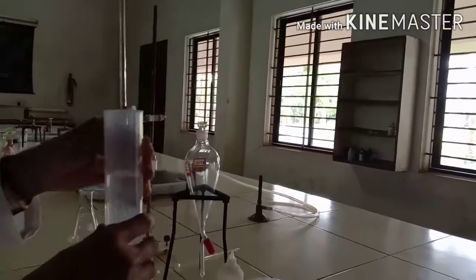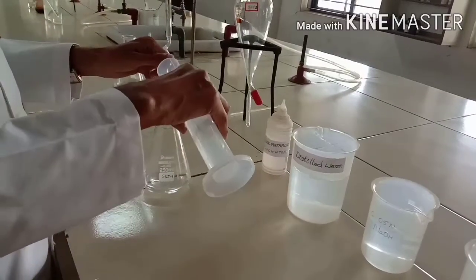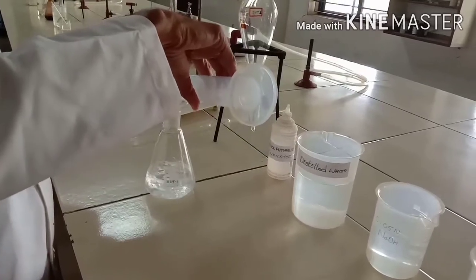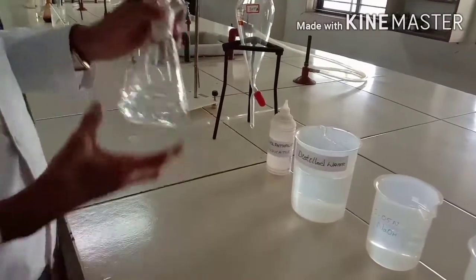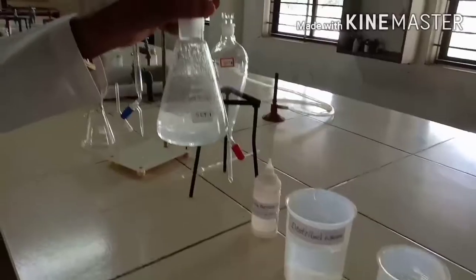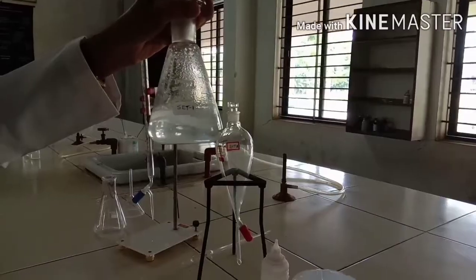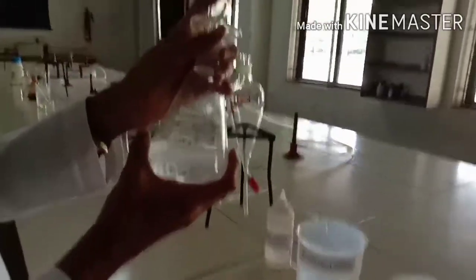This water serves as the aqueous layer. The benzoic acid will now distribute between the benzene and aqueous layer. You have to shake for 30 minutes to achieve equilibrium, because the benzoic acid should solubilize in both phases. Shake vigorously.